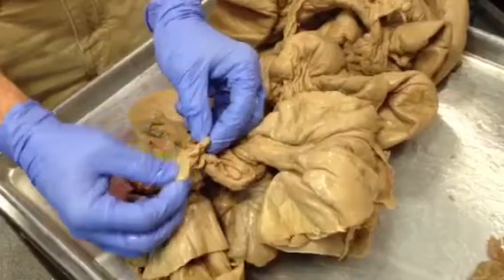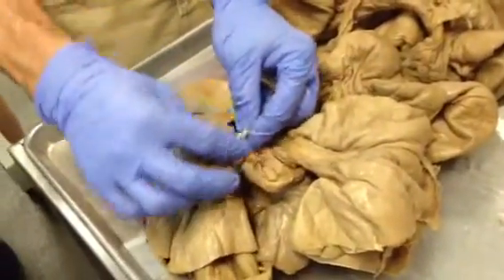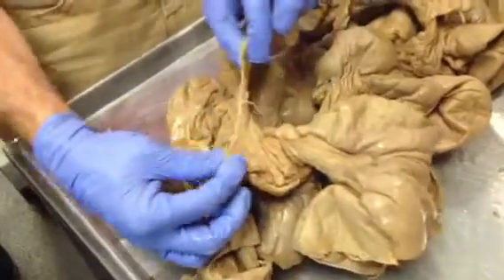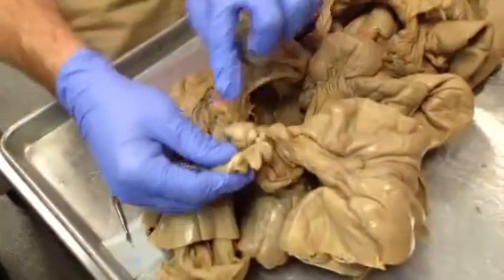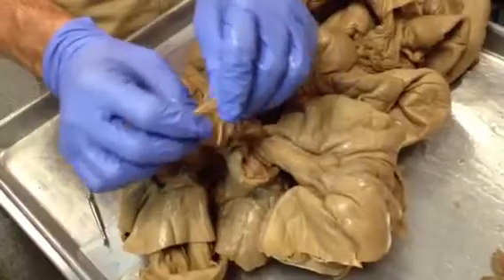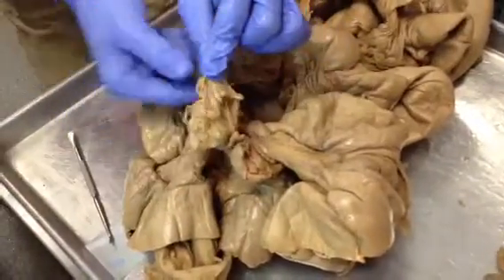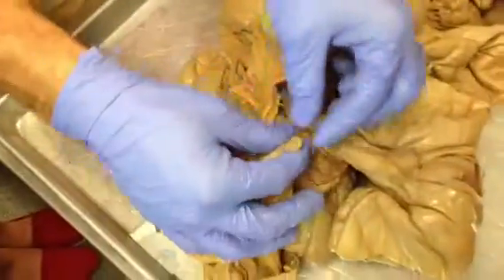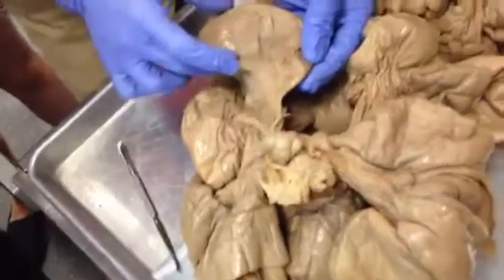And you see the tube goes here. See that? Is everyone with me on that oviduct, the fallopian tube? It's kind of zigzaggy. And then here's where it kind of goes into the uterus. So it should be clear to everybody. Okay, so ovary, fimbriae, all this, it's not feathery so much as like a hoodie. Are you with me? And then you can kind of see the oviduct starting, the zigzaggy tube. It kind of straightens out, and then it gets real wide, and at this point we would call it uterus.